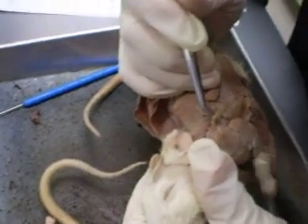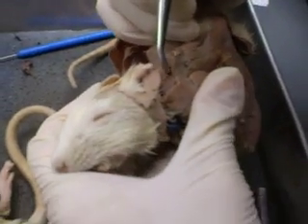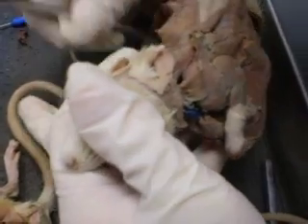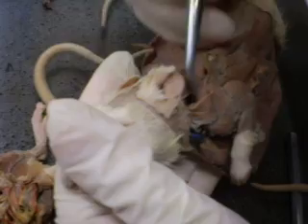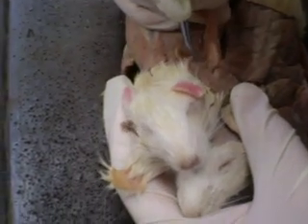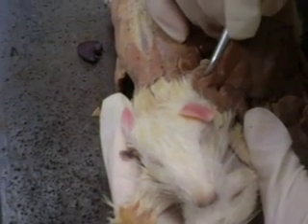If you notice it, this portion is over this portion. That's the cervical trapezius. This portion that's a bit deeper, that's your rhomboideus. And then underneath your rhomboideus will be your splenius, S-P-L-E-N-I-U-S. Cervical trapezius. Then on the inner layer is the rhomboideus, like this layer right here.